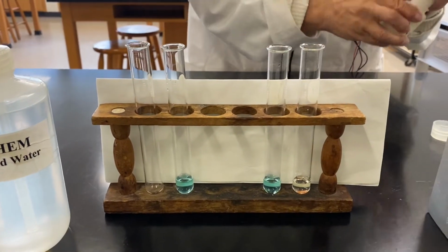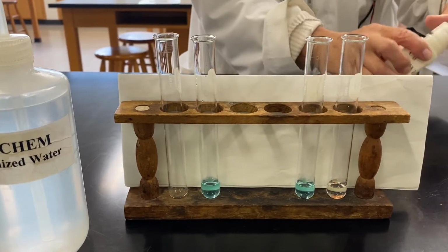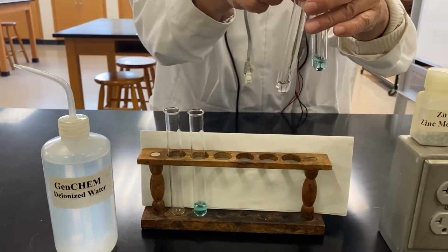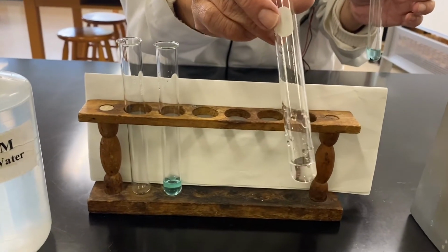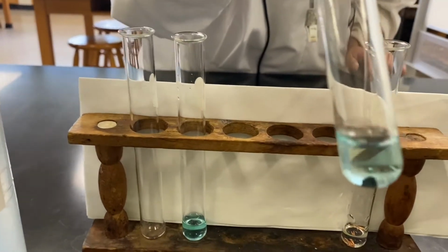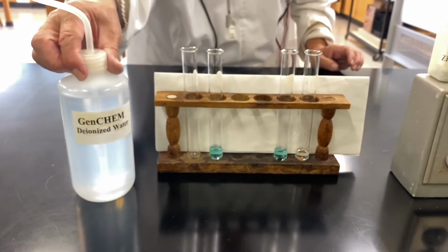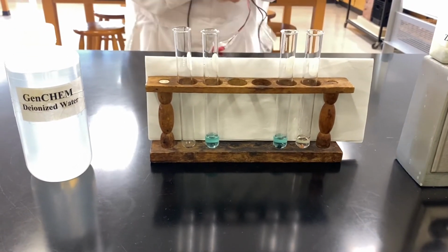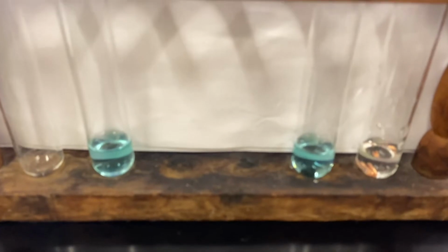And now after we placed those 2 metal pieces in, and then we give a really good shake, you can see the copper metal remains the same way. However, our beautiful shiny silvery looking zinc metal now is covered with a black deposit. All right, so that indicates a new material is formed.